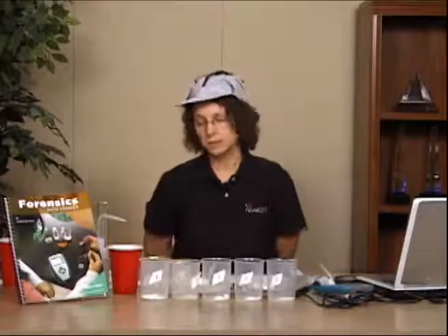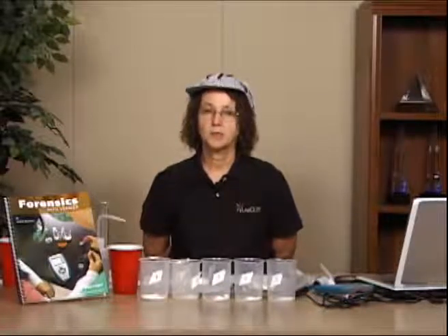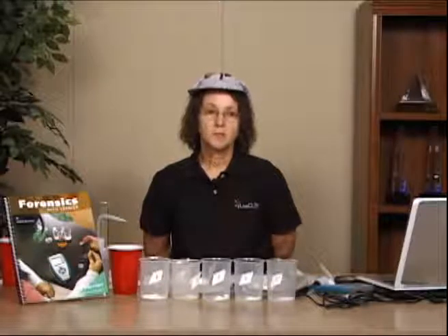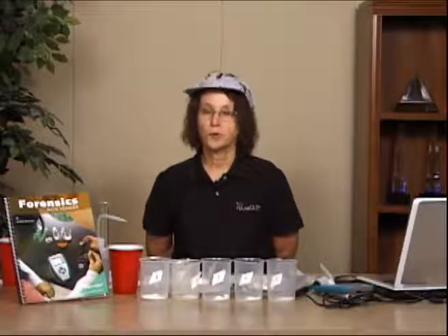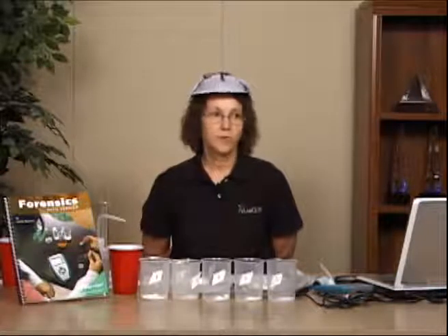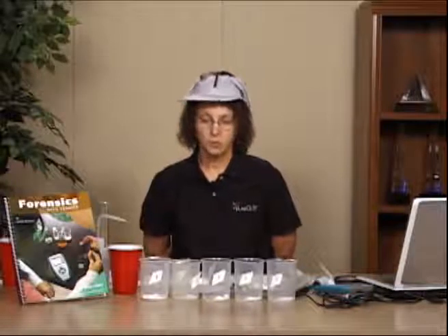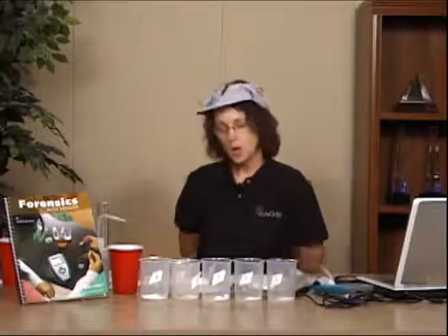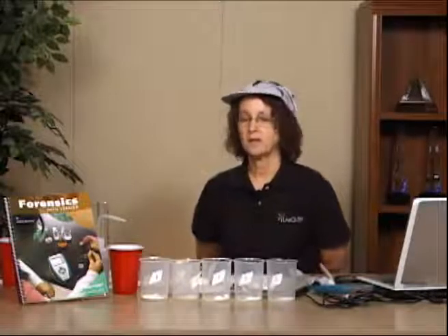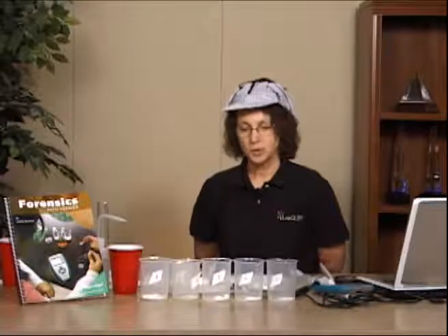In this particular lab, we have Yuri Orlo, who's been pulled over and considered to be drunk or intoxicated in some fashion. And in doing some testing, they also noticed some white powder on the front seat. So the question that's posed to the students is, what is this white powder, and should the police, in fact, press additional charges, possibly of drugs? And so we've taken some samples of some white powders, and we're going to try and identify what our mystery unknown is and find out if Mr. Orlo is, in fact, a drug user.